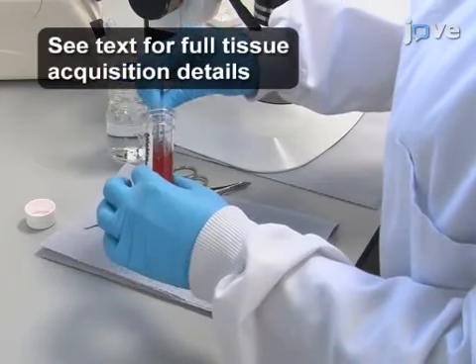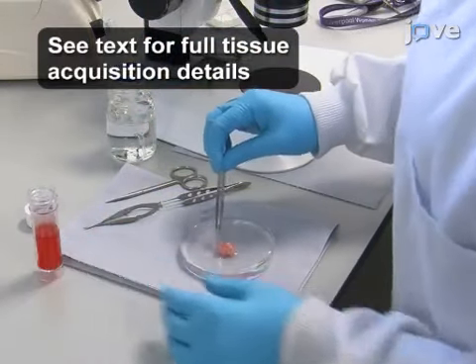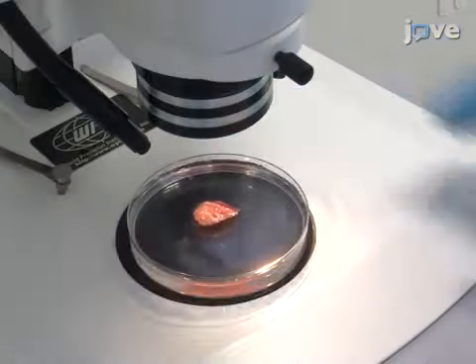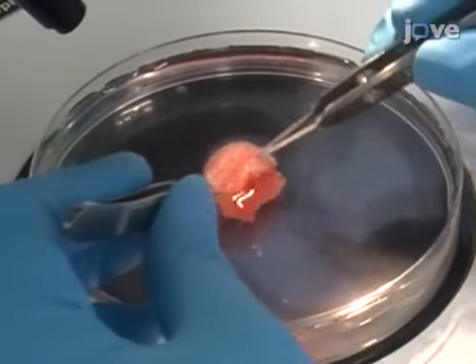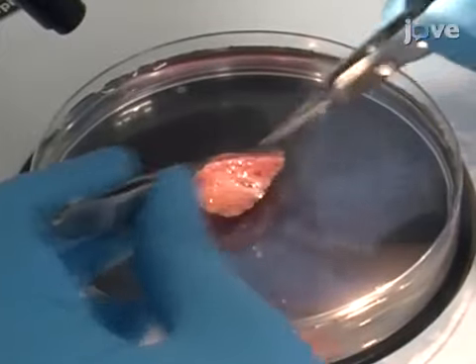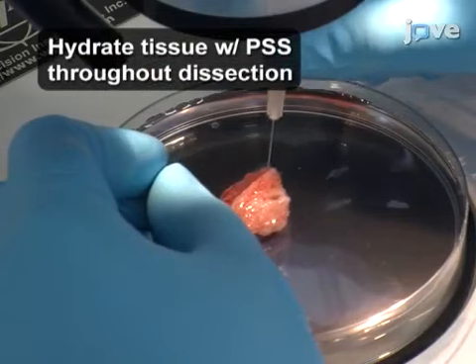Place the pregnant human myometrium biopsy sample into a clear Sylgard-based dissection dish filled with PSS and place the dish under the microscope. Carefully orientate the biopsy so that the serosa and decidua edges can be visualized. Secure the tissue to the dish base with dissection pins.